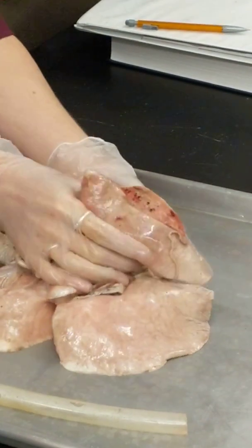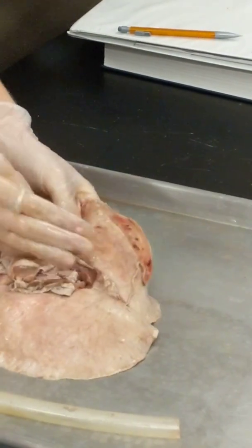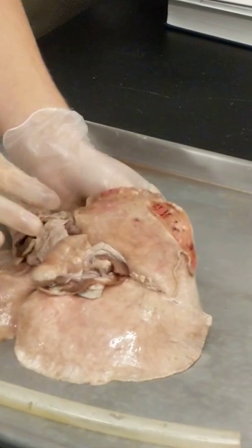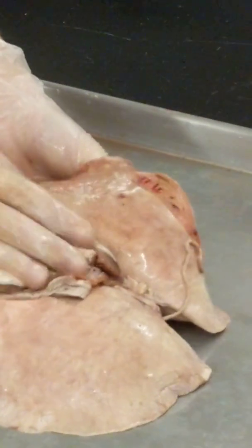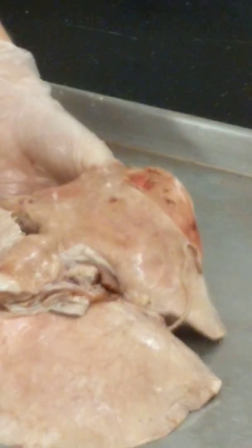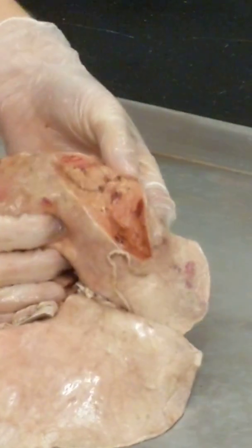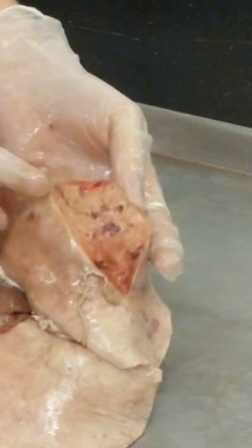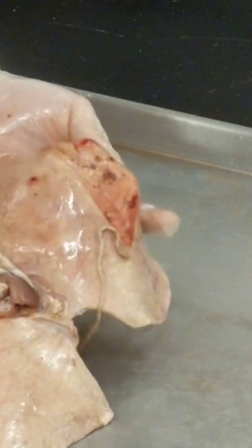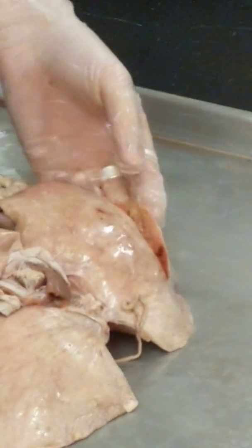All right, so if I open it up, you guys can see it's very dense. But very quickly, the tubes that lead into your lungs branch into really small pieces, very, very quickly, because you want all that air to get into the alveoli so you can have gas exchange. That's the whole purpose. So you can see that there's some tubes inside of there. You can see these are probably the smaller ones, the bronchioles. Yep, and we'll look at a couple of the structures on these models right here.